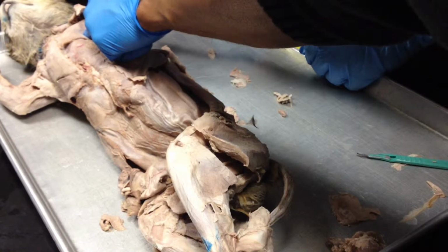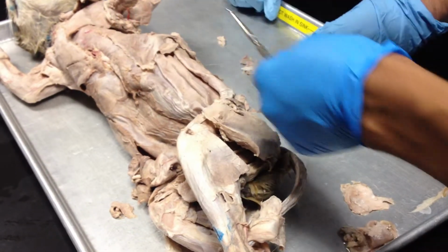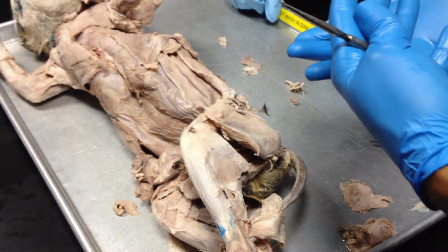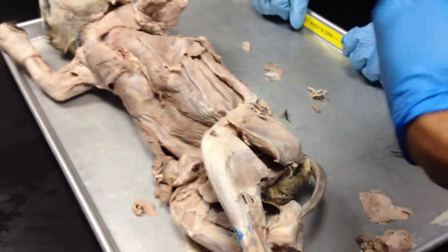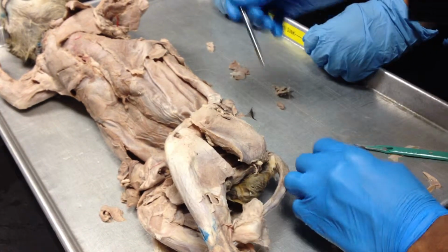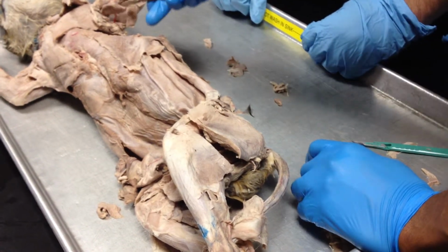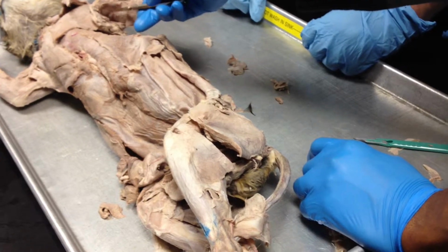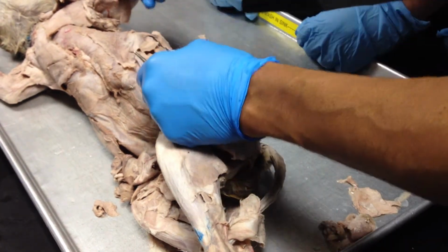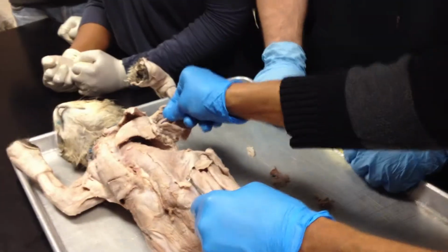These are blood vessels, blue and red, but that's not their native color because the cat has been injected with a specific dye, liquid silicone, which then dries in the vessels. So it is used to study the blood vessels. The blue ones are called veins, and the red ones are called arteries. And then you can see some white fibers, those are the nerves, part of the nervous system.